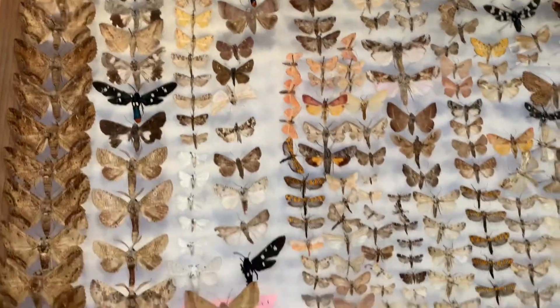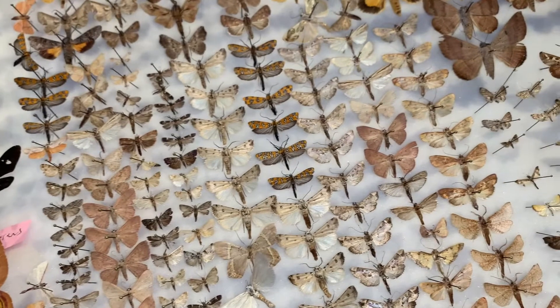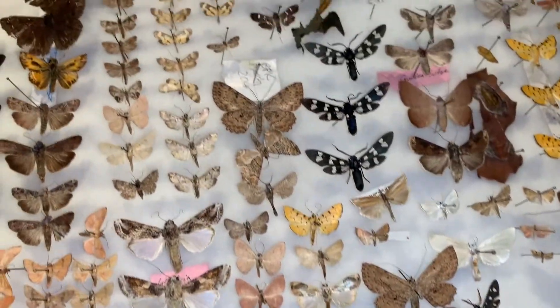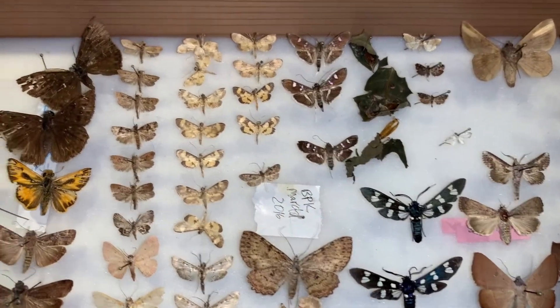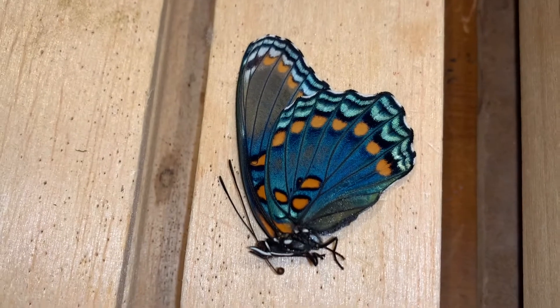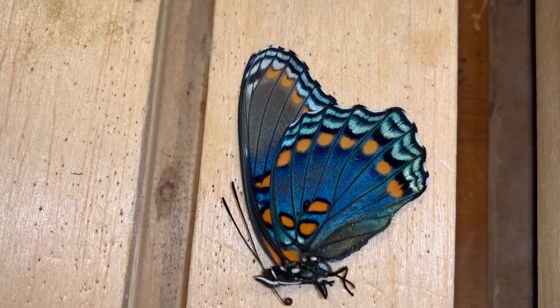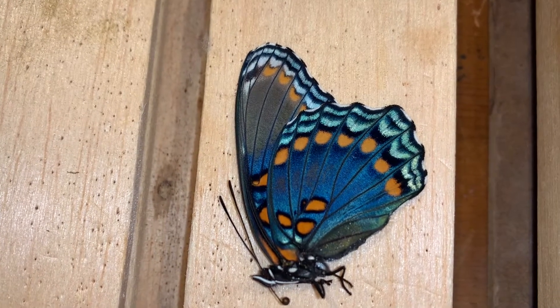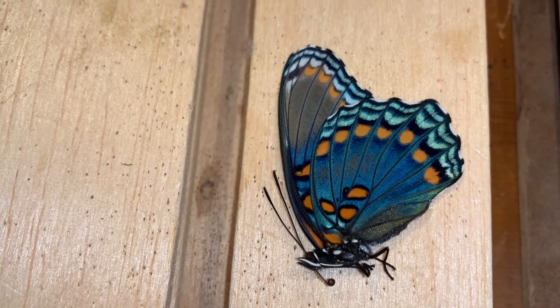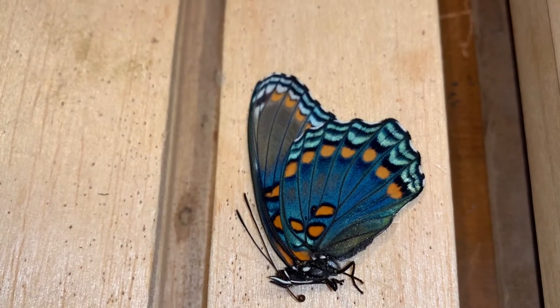That is the whole heart behind scientific collecting. We collect very few butterflies, but this video is all about showing you how to prepare a Lepidoptera specimen for scientific purposes. The species of the day is the red-spotted purple butterfly — that is Limenitis arthemis astyanax. Down in South Florida we don't have these butterflies; I've actually never really collected them in Florida — I've only had one specimen for a long, long time.